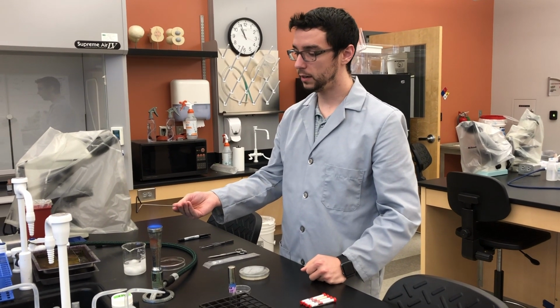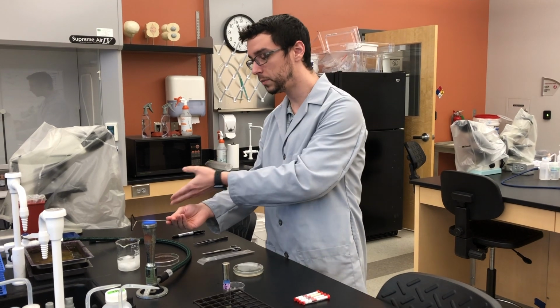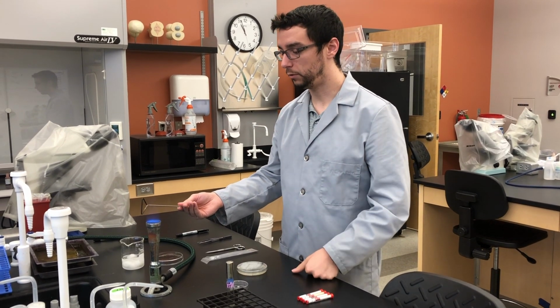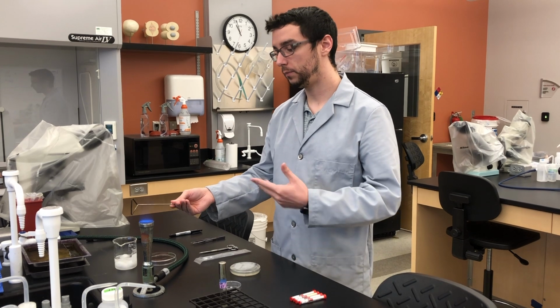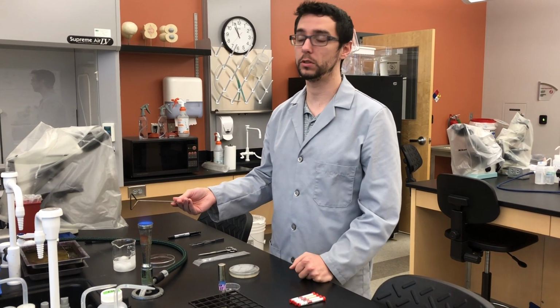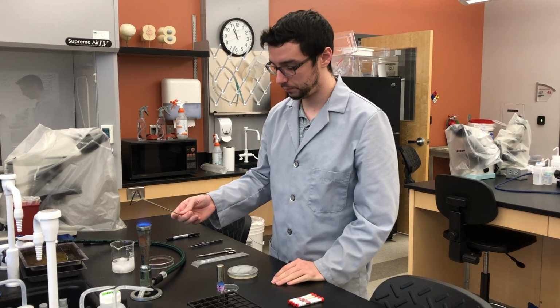Now, keep in mind, for safety reasons, you want to keep this near the flame, away from the beaker of alcohol, not waving it around, dropping flaming alcohol all over the place. And you want to wait and make sure this completely cools. A few of you ended up killing your bacteria because you didn't wait long enough and you didn't have anything to work with your spread plates. So make sure that you wait long enough.